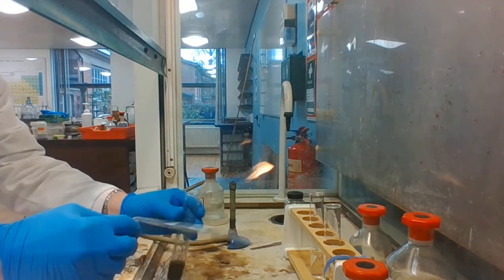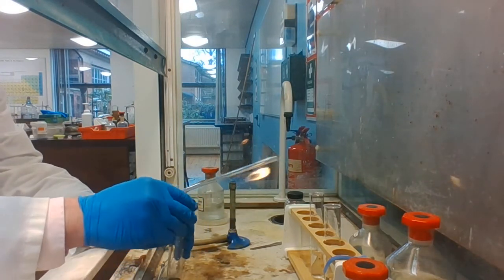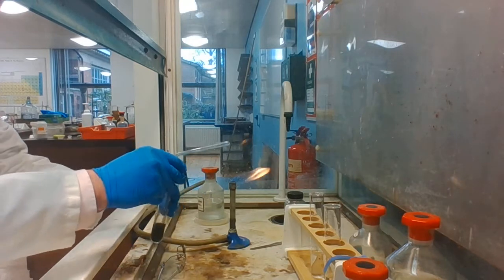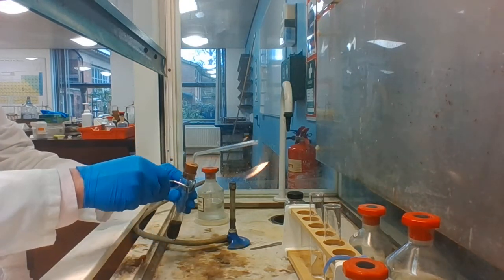The reaction between hydrochloric acid and manganese dioxide generates chlorine gas. Sometimes it needs to be heated a little bit to get the gas to come off.